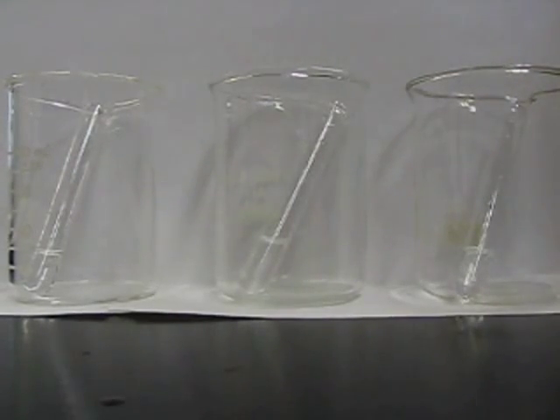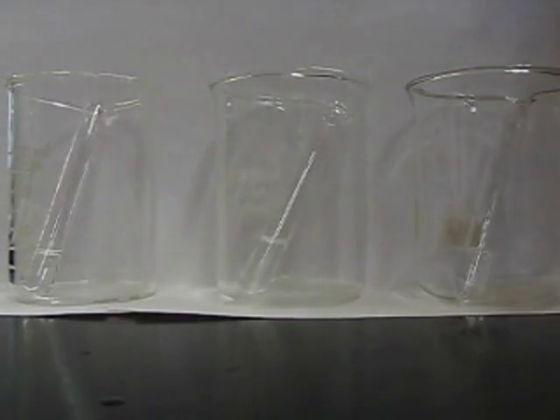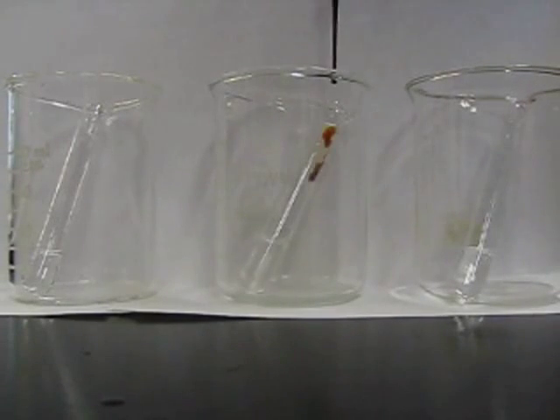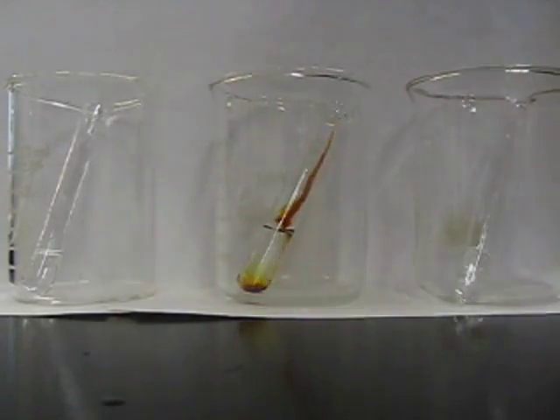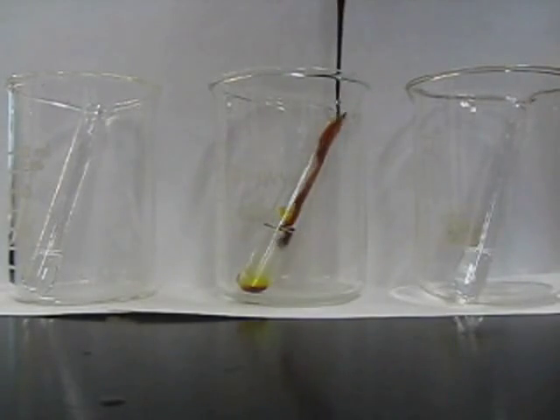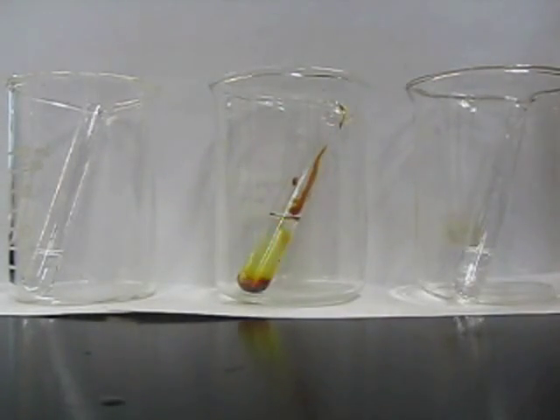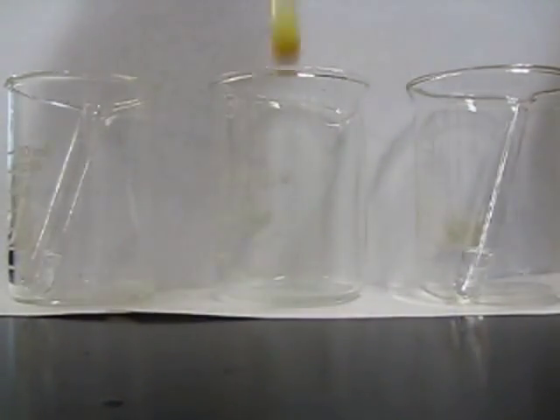Now what we're going to do is add a potassium iodide and iodine solution. What this is actually doing, if anyone's curious, is undergoing a haloform reaction if we have a methyl group next to our alcohol.